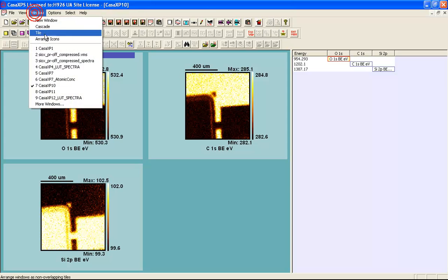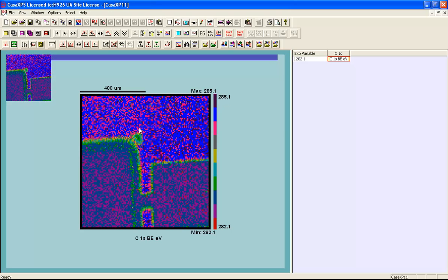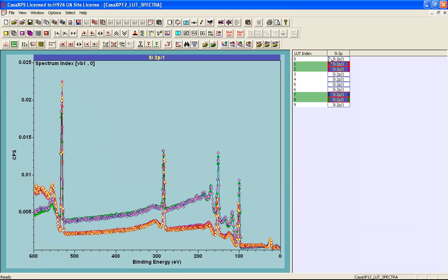So let's look at a partition, and here we see the binding energies of the carbon 1s have been partitioned into different colors, and these colors mark up different sections within this image. So these two colors here are predominantly where the elemental silicon is dominant, and these two colors are where the oxide is dominant. So when we construct spectra from each one of these colors, we end up with 10 spectra corresponding to the 10 colors, and I've picked out the two that are highlighted in the image, being from the elemental and the oxide zones.